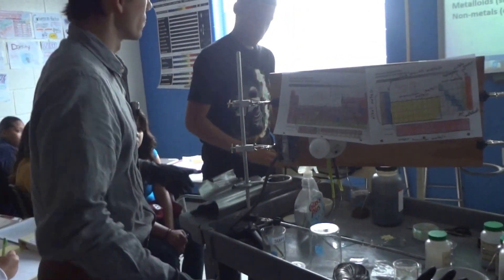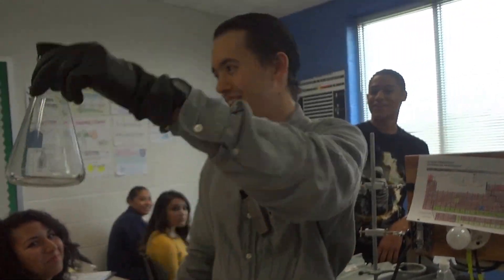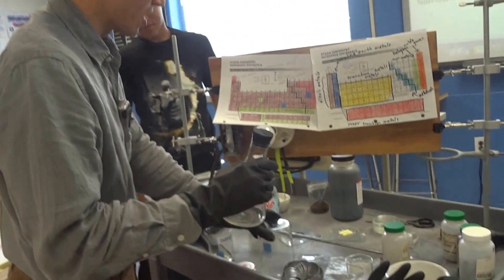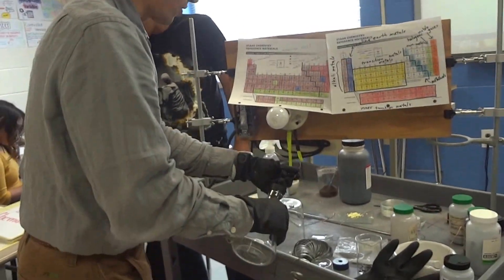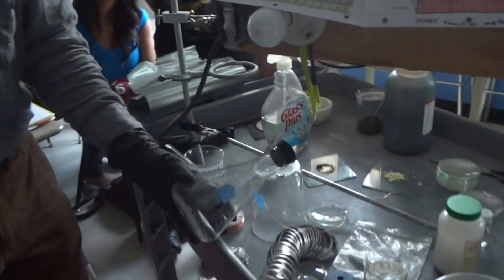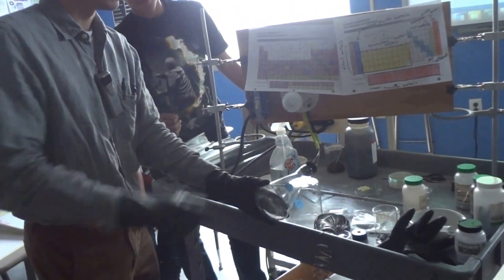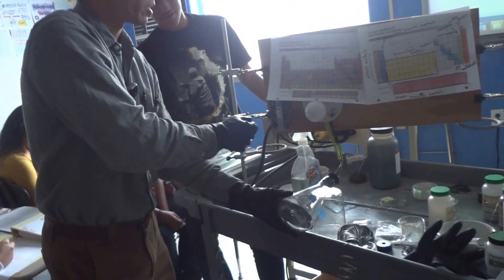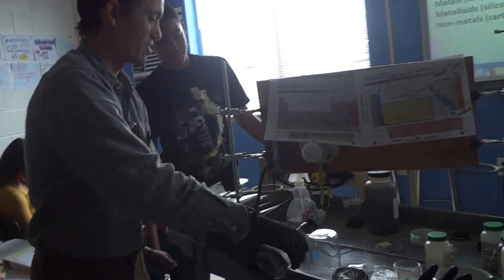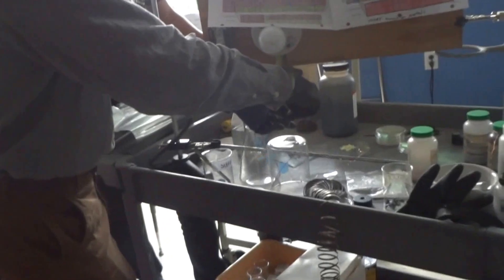Now we're going to test one more element: oxygen. Here's oxygen — it's invisible. Let's pass the two wires into this flask and see if it conducts. Plug it in — it doesn't conduct. Oxygen is a non-metal and is not a conductor. To confirm the circuit still works, I'll touch the two wires together — and it works.